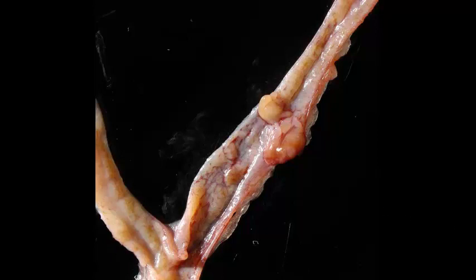Okay, time's up. We're looking at a bicornuate organ, which is the uterus, in a rat, and there are multiple projections from the wall into the lumen of the uterus. These are polyps. They can be straight endometrial polyps, which are polypoid projections of the epithelium, or more likely they are endometrial stromal polyps, and the bulk of these polyps is composed of uterine stroma. Endometrial stromal polyps are not an uncommon finding in older female rats, so that's one for you to remember.